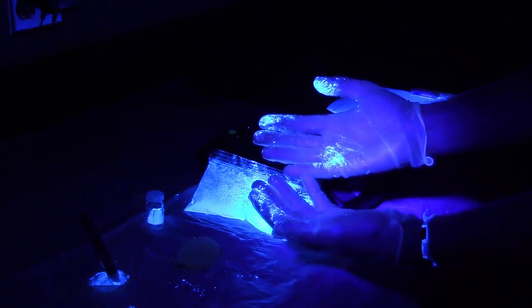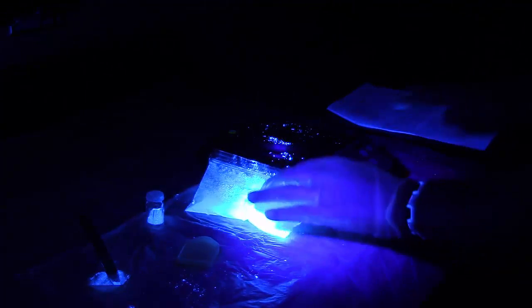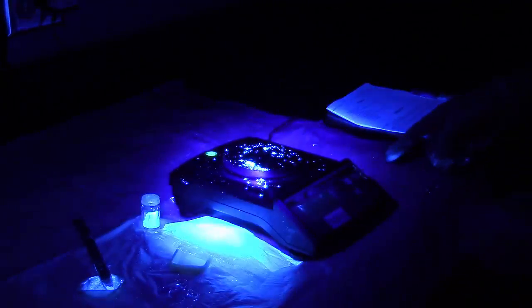Turn the lights down in the room and using the black UV light, inspect the work surface, the weighing balance and tools used, the learner's gloved hands, the learner's clothing, and any exposed skin to see how contaminated the surfaces are.